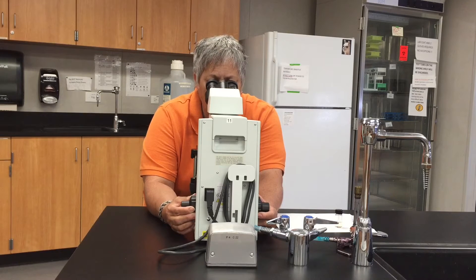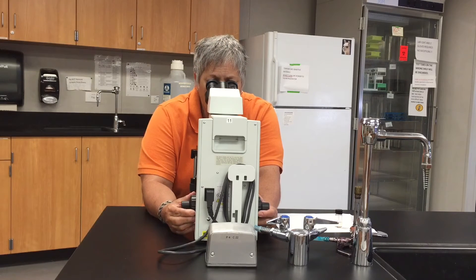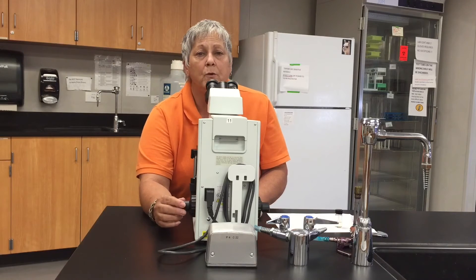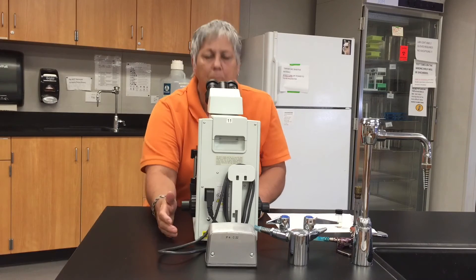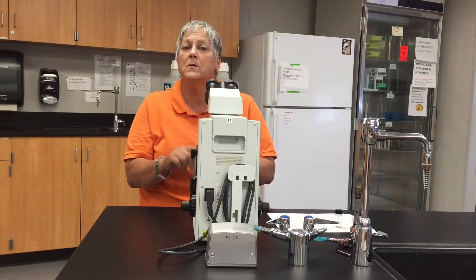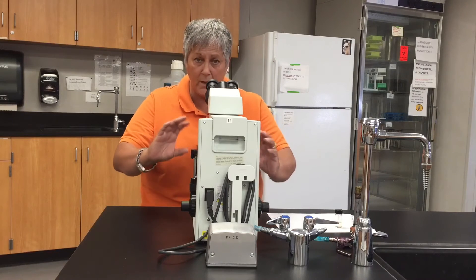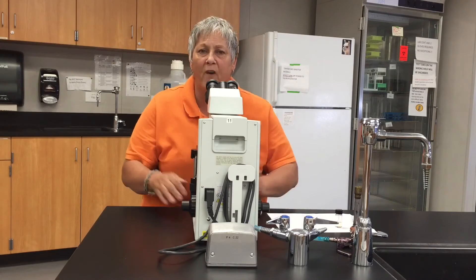I see something there. I'm not sure if that's what I'm looking for, so I continue to lower the stage a little bit more — but I don't see anything else, so I go back to that original location. There it is, and then I use the fine focus — the smaller diameter knob — to bring it into nice sharp, clear focus.